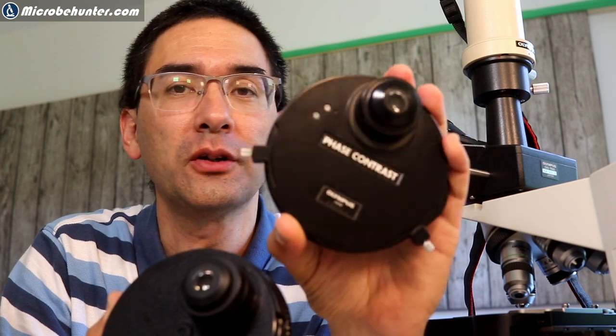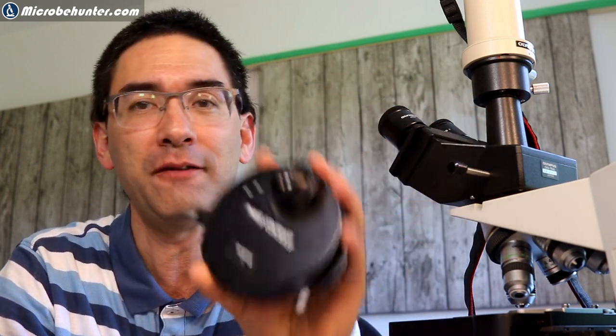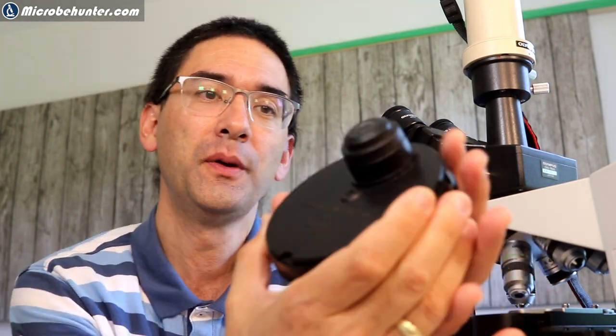The reason is because over here, that's my old condenser and it didn't work with the objective that I have here. So I now have a new one here and this one works fine. I'm quite happy with that.